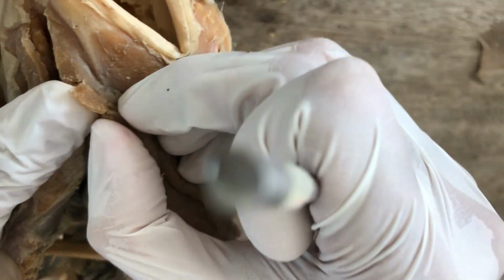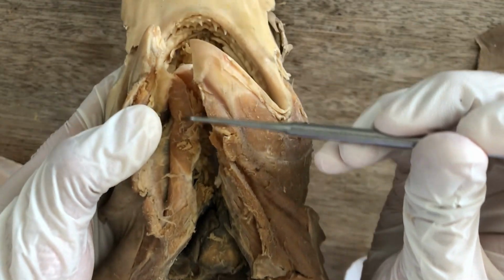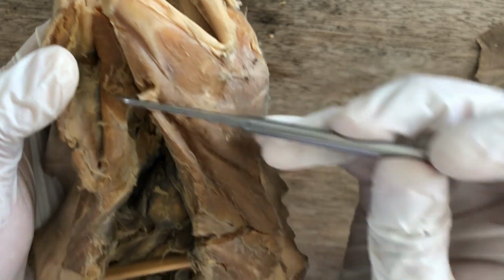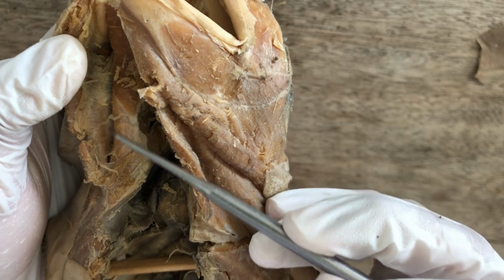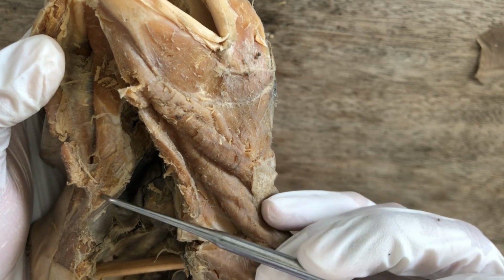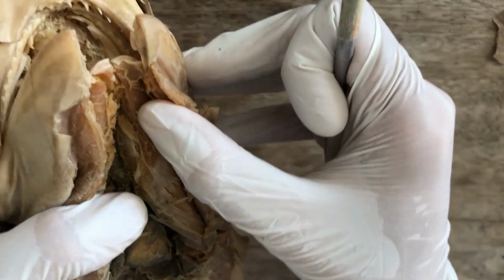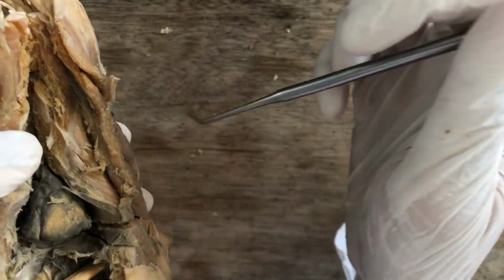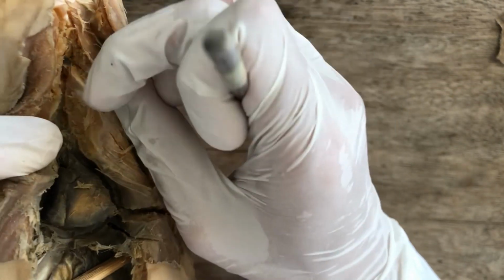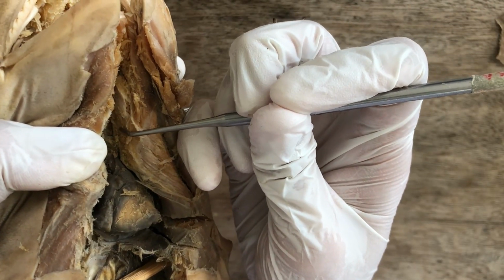And then deeper to them, I'm gonna reflect the two, and you'll see this long and thick muscle. That's the coracomandibularis or coracomandibular muscle, originating from this chunky muscle near the coracoid bar, the common coracoarcual. And let's see if we can see the coracohyoid. So again, this is the coracomandibular, common coracoarcual, and then deeper, this one is the coracohyoid.